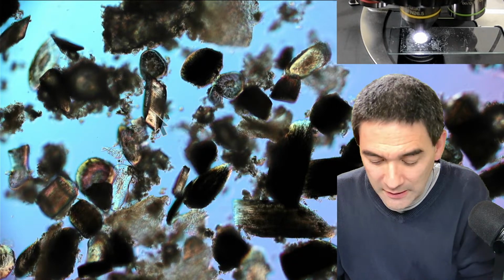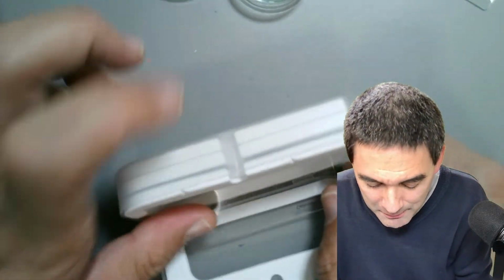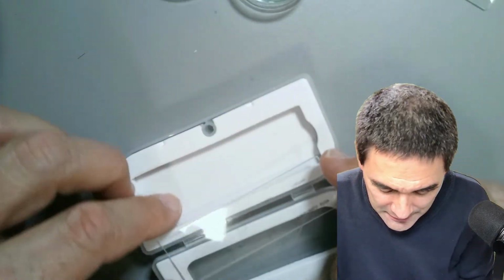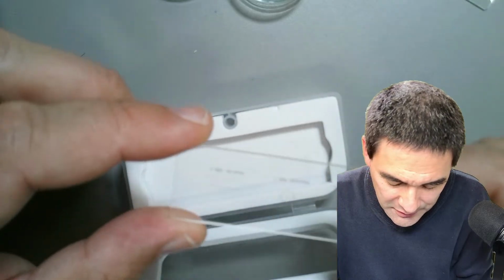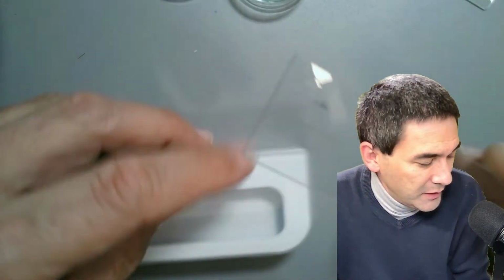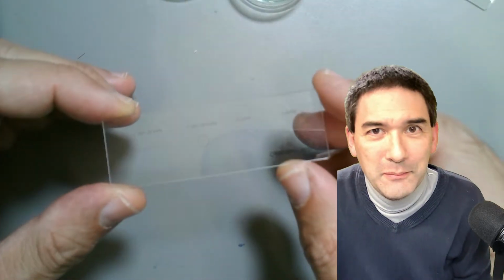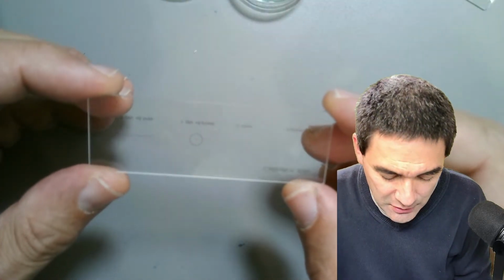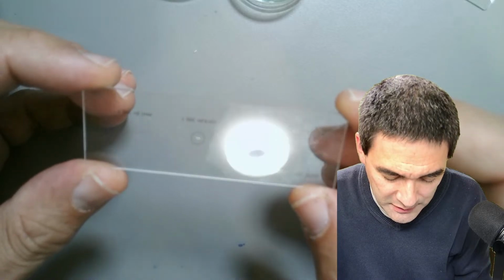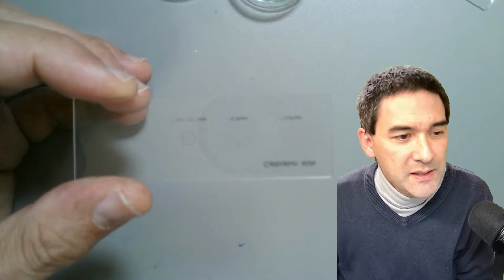Okay, so what I have here, luckily, I'm going to show you the desk quickly. Some of you might already know this is a micrometer slide, and this basically has a scale on it. This is something I did not plan to do today, to measure how much my beard is growing in a day, but why not? We can be flexible. And what does it say here? One division is 0.0 something. I cannot read it. We're going to have a look at this.